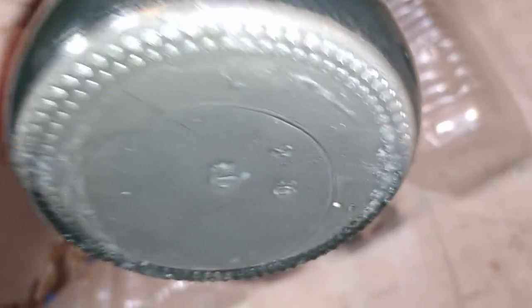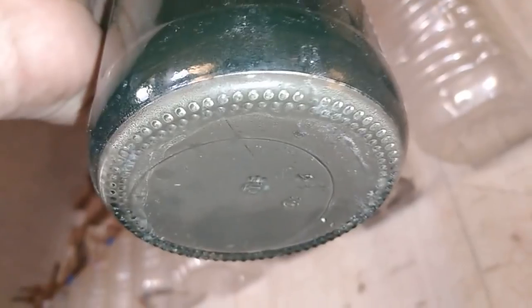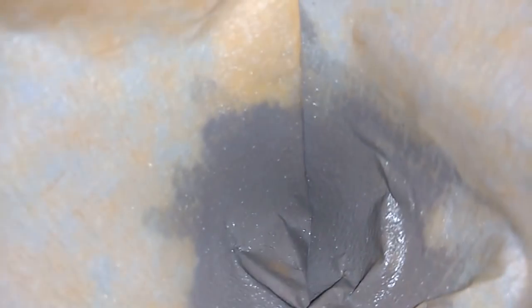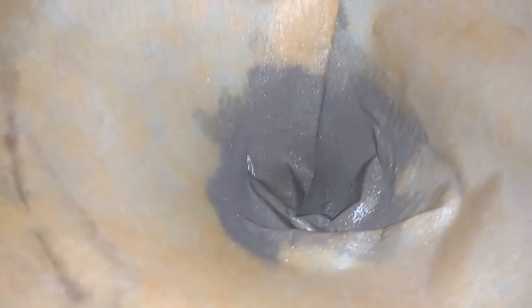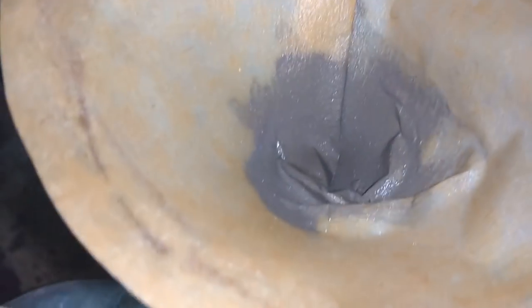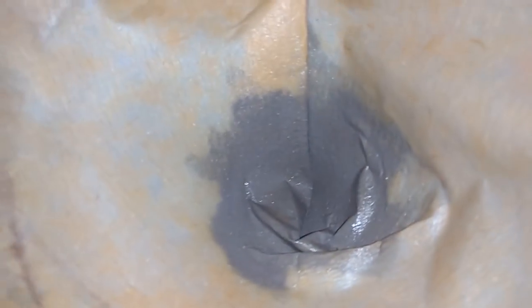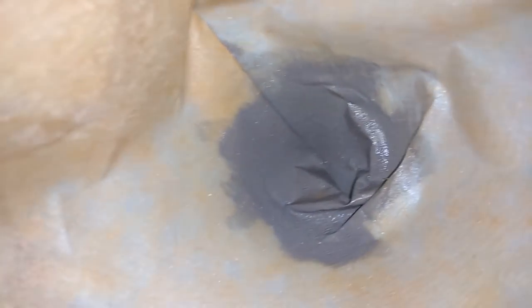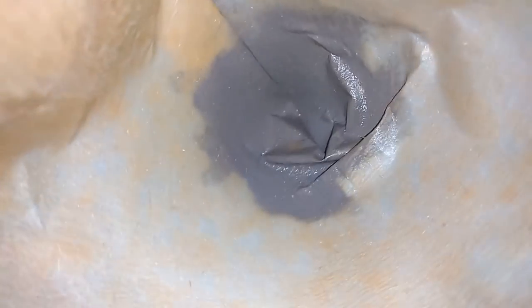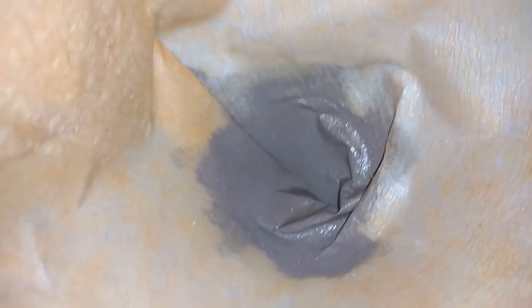Let's see any more gold from that 500 modem pile. I will refine that again. Let's filter that and refine with the filter. So this is the gold which I harvested in the filter — the water is clean. It's not too much, but I will do a second refine to collect it all, just because of the yield. I noticed that you love that second refine and the final result at the end.